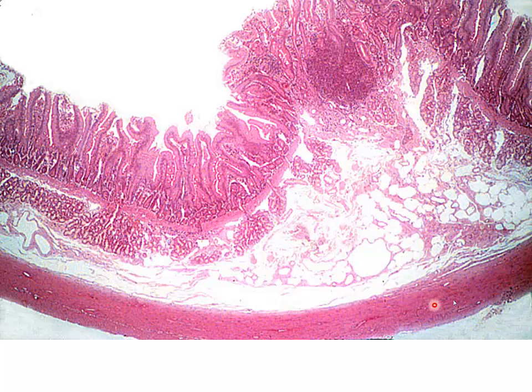Sometimes you may have this. It's mostly in the sphincters, the pyloric sphincter and the ileocolic valve, where you're going to see that. But this extensive swelling of our submucosa, that's going to push this upwards into the lumen, and that is our plicae circularis, or our valve of Kerckring.